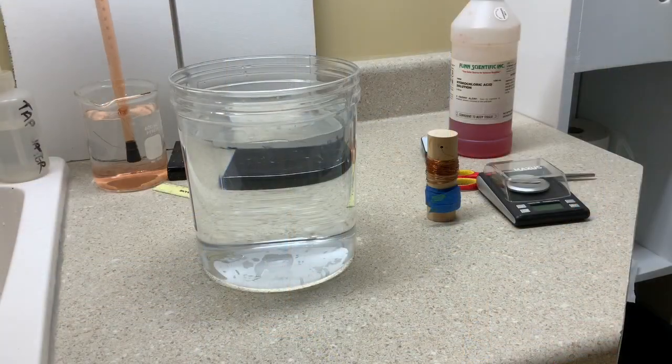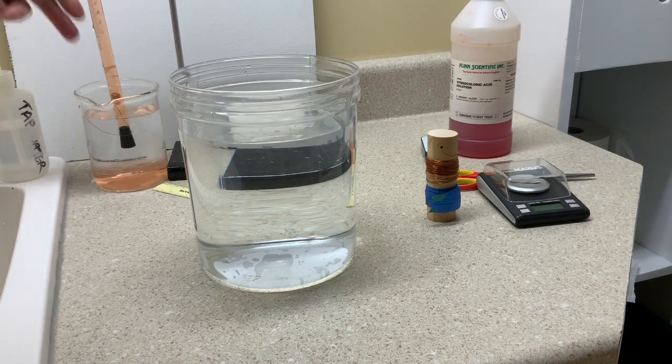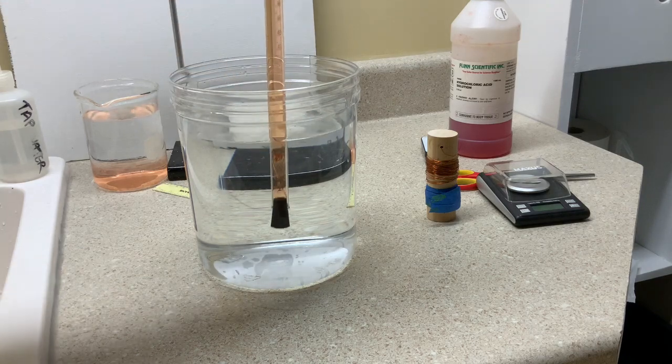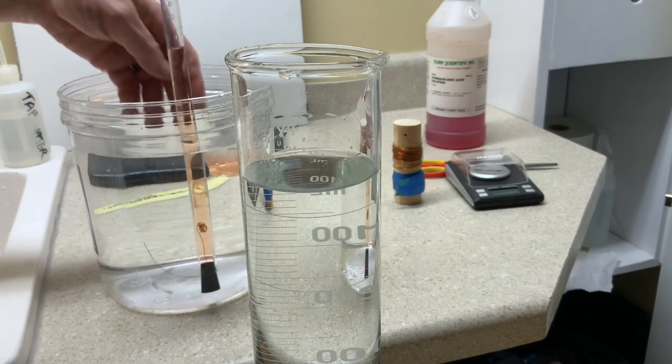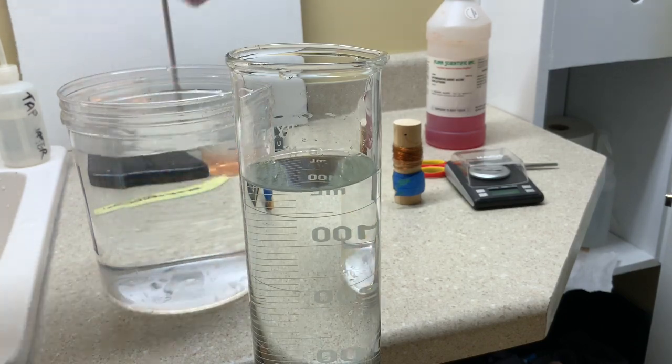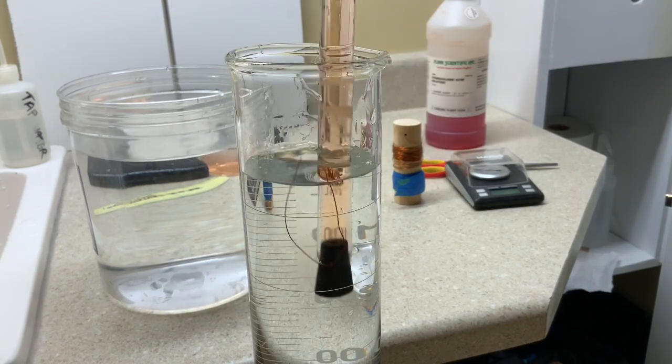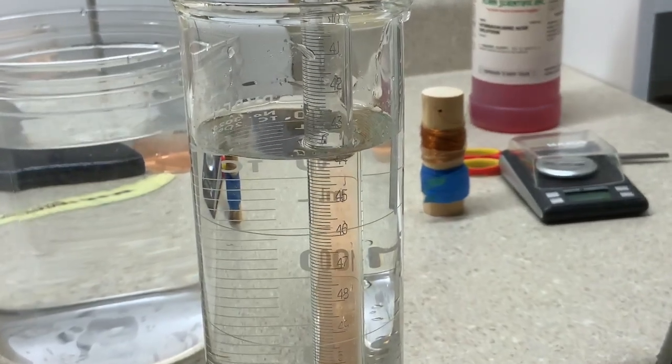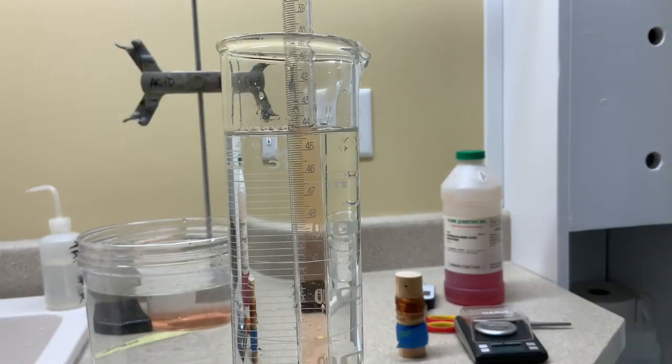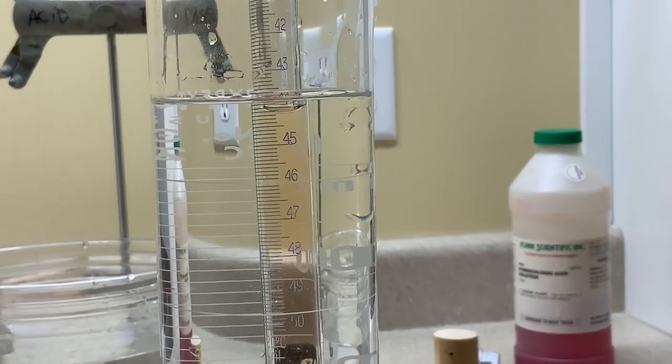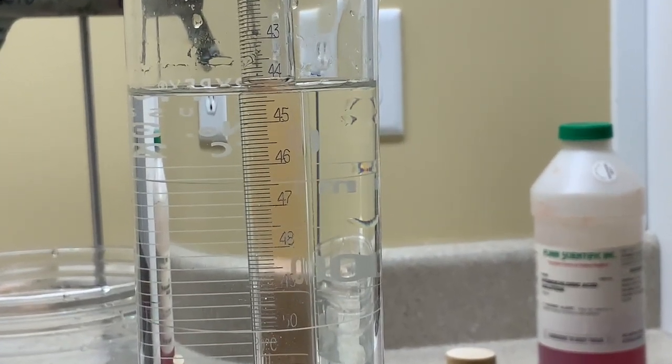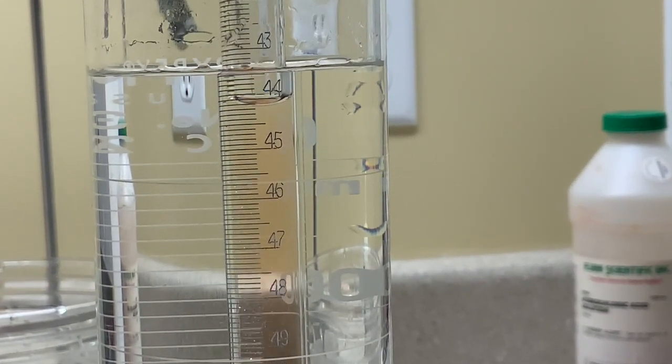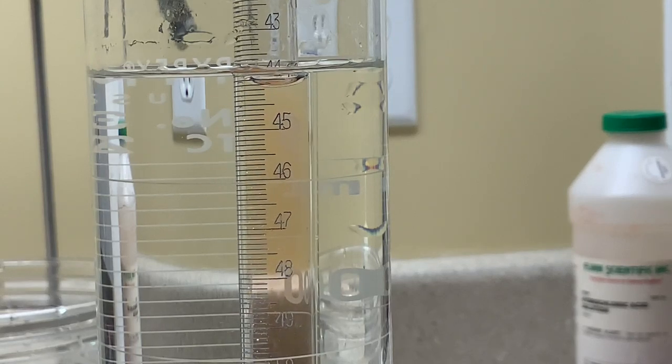And when the reaction stops, you can see that the water is still above the surface of the water in the beaker, so we'll transfer to a deeper container. Oops, not deep enough. Let's move into the very large graduated cylinder. And we'll make the level of water in the eudometer even with the level of water inside the graduated cylinder. Look carefully; do your best to record a measurement for the gas that is present above the water, and record that to the right number of significant figures in your Google form.